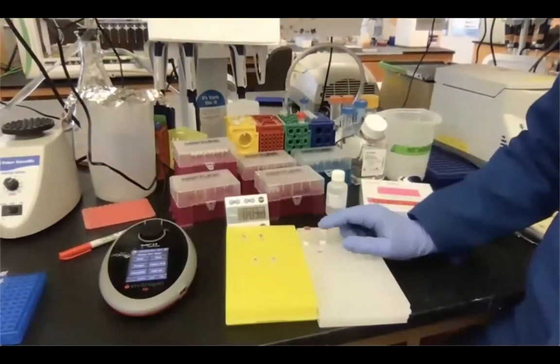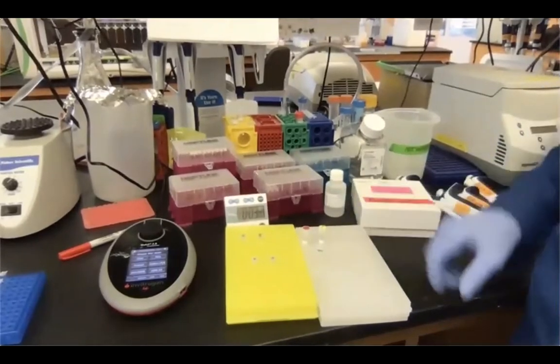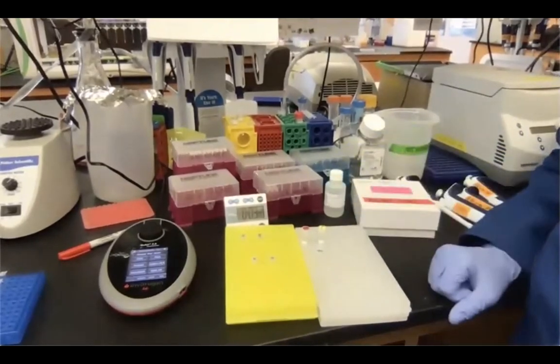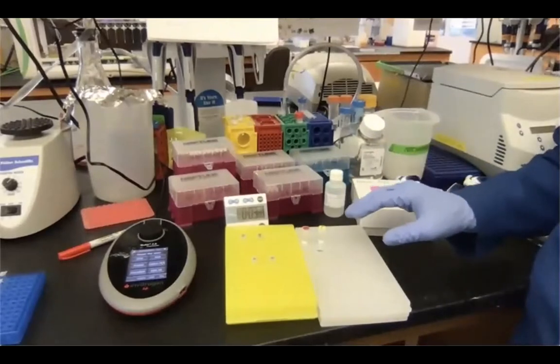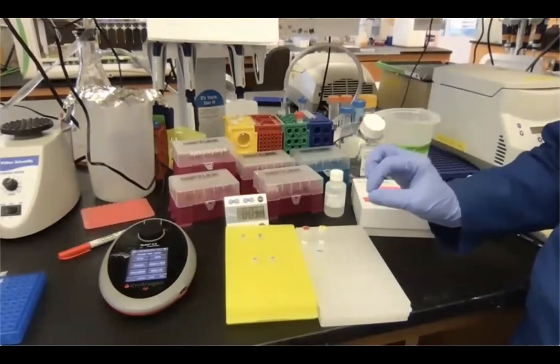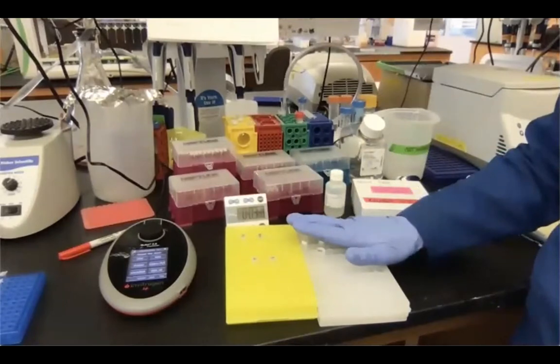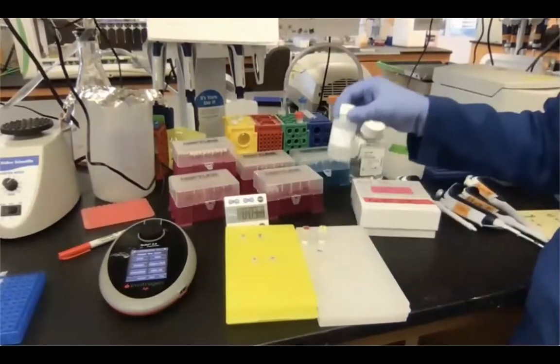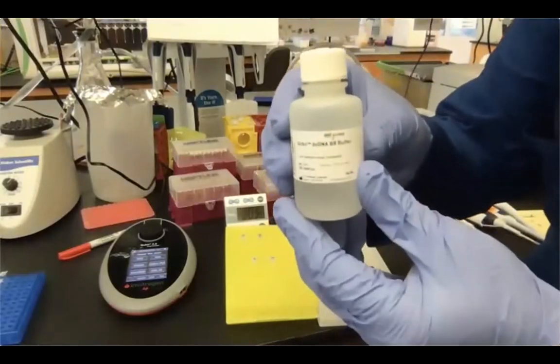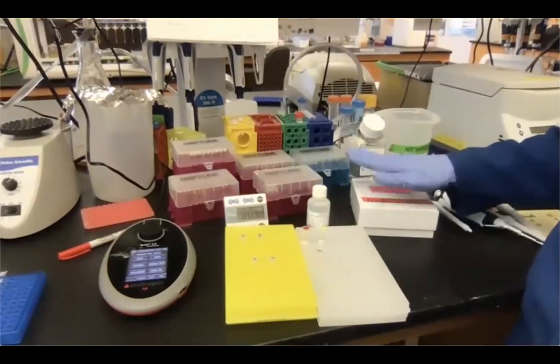And so for precise pipetting, I would suggest you take them out 10 to 15 minutes before performing the measurement, okay? As I told you before, you can run different assays using the Qubit. What we are using today is called double-stranded DNA BR, which stands for broad range. And each assay has its own specific reagents. Standards are specific for dsDNA BR. The buffer is specific for double-stranded DNA BR. And also the dye that we're gonna use later is specific for double-stranded DNA BR, okay?